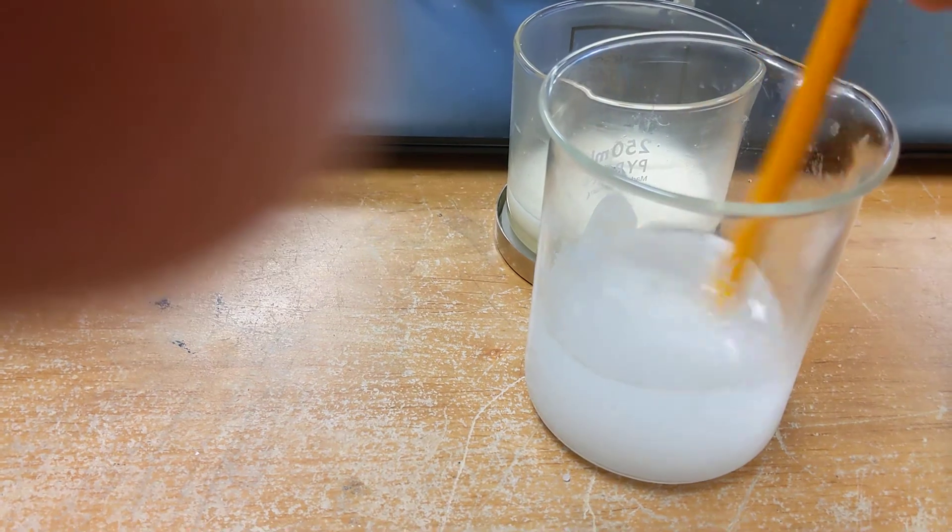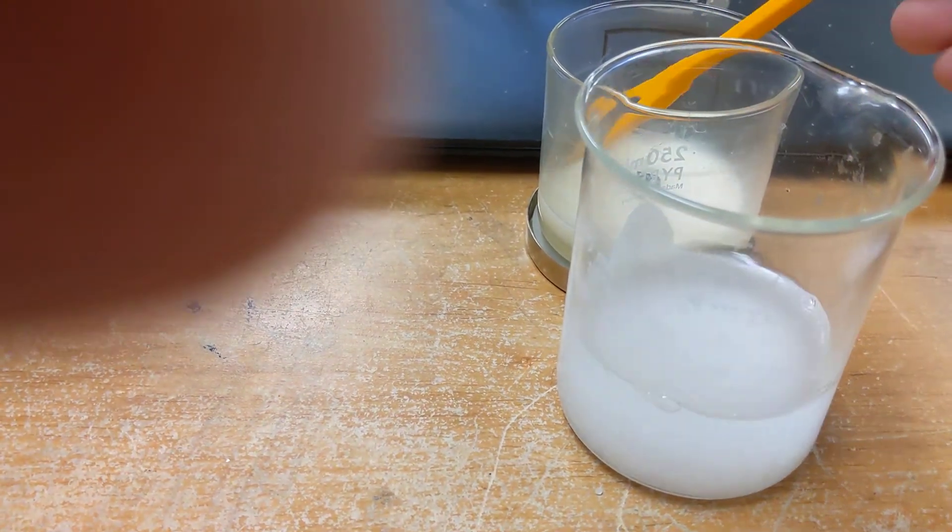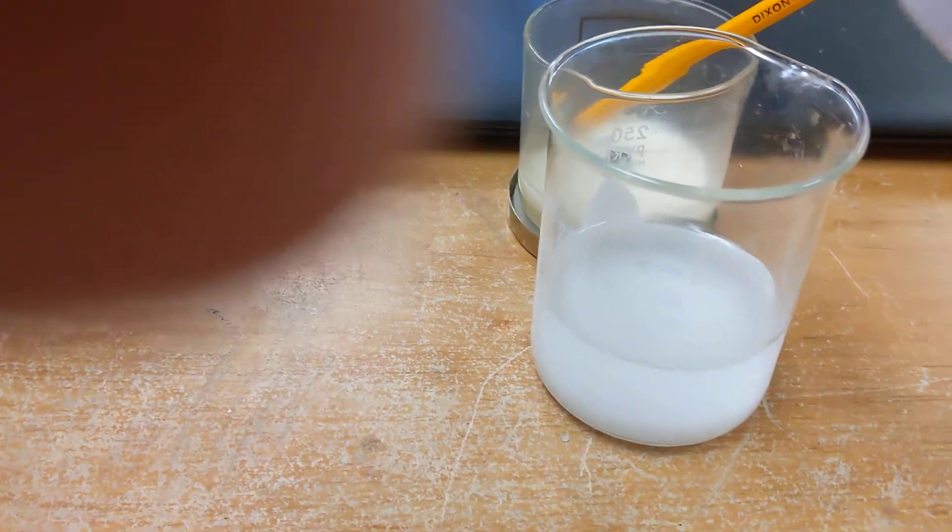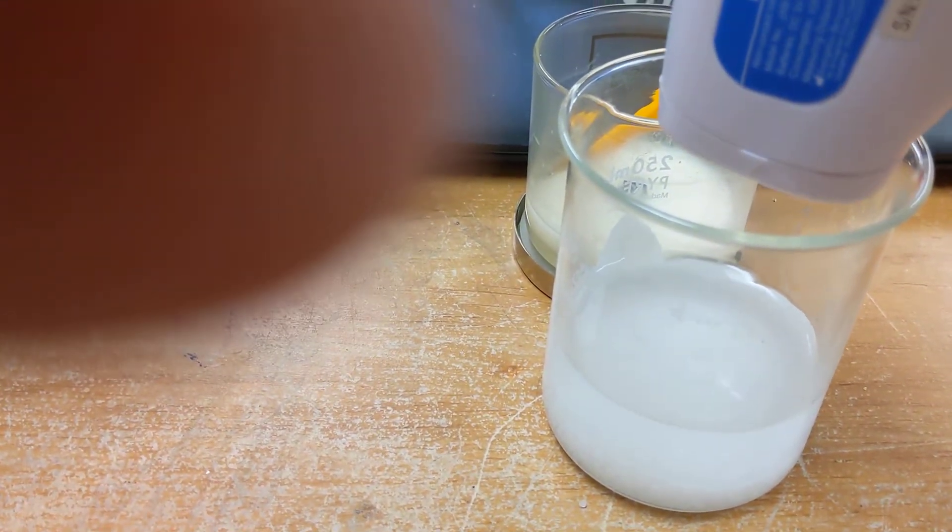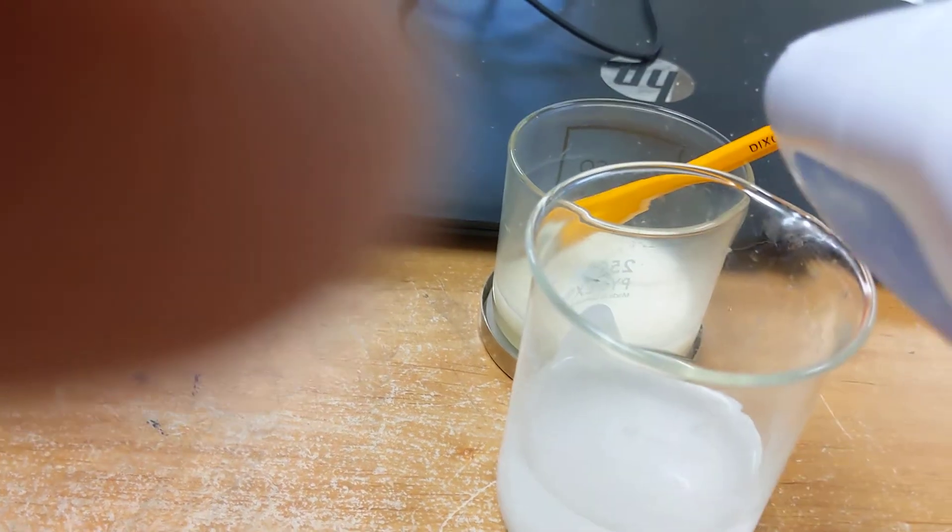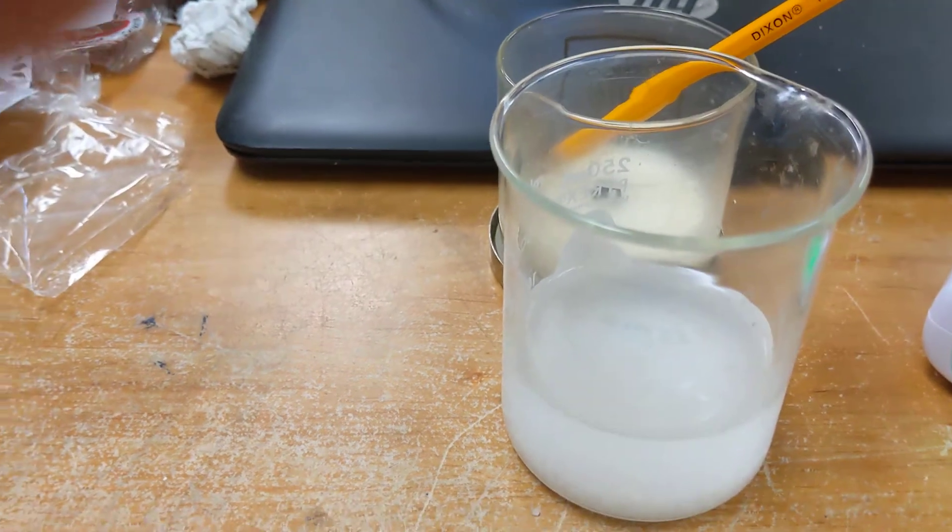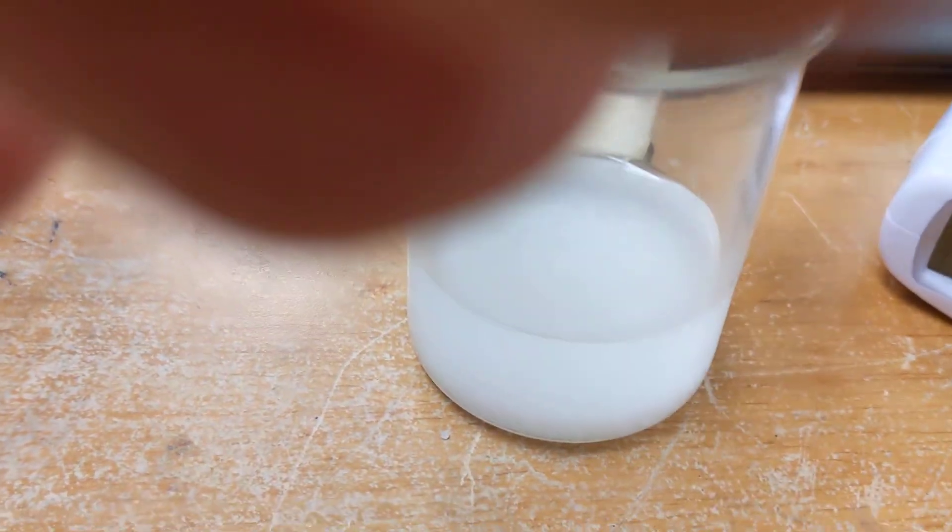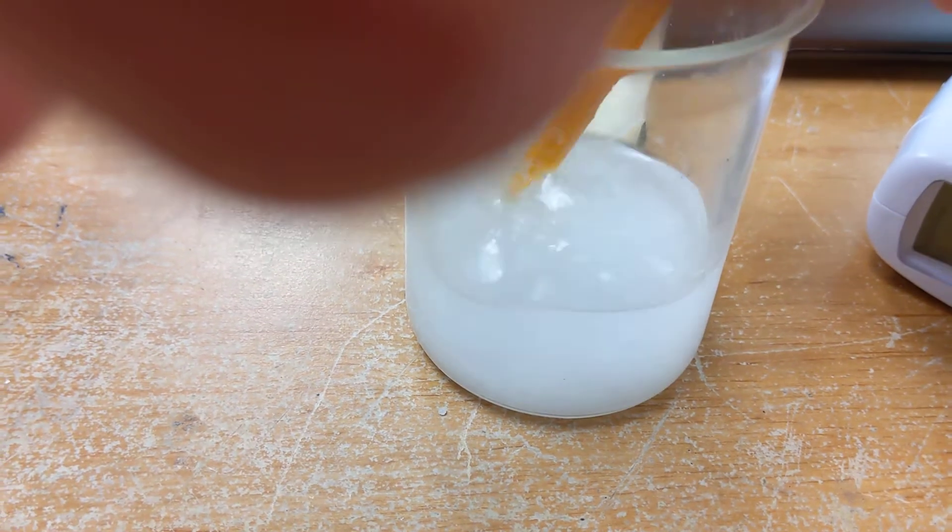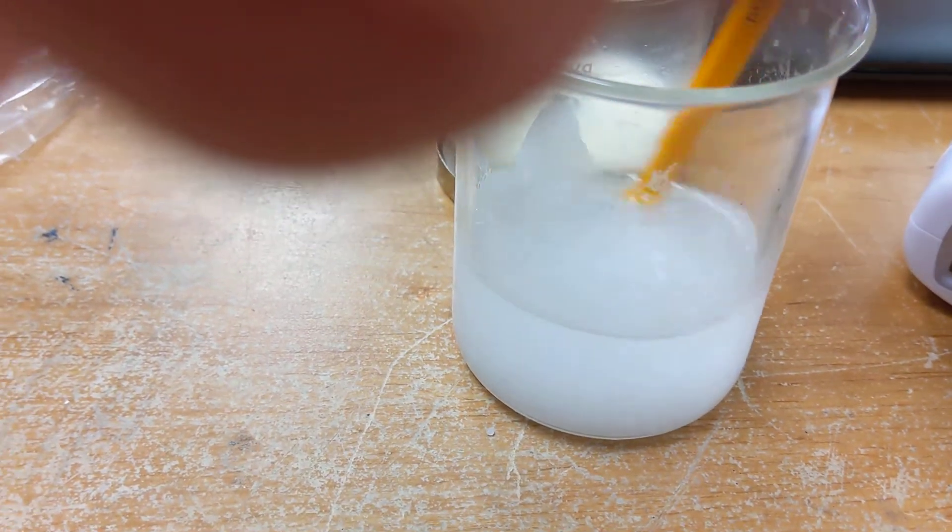We keep stirring. I'm not drinking it because it produces ammonia. Temperature still dropping, it's 43. It's ammonia liquid, used for cleaning products.